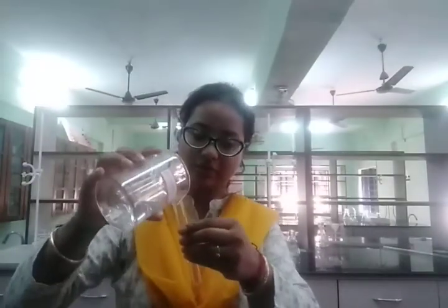Good afternoon, class. Today we will be doing the experiment of identification of acid and base without using indicator. So without using indicator, how can we detect whether a solution is acid or base? For that we have to use some chemicals. For acid, I will be using dilute sulfuric acid. In a test tube, I'm going to take a little amount of acid.